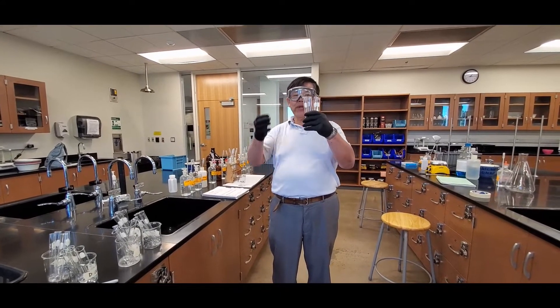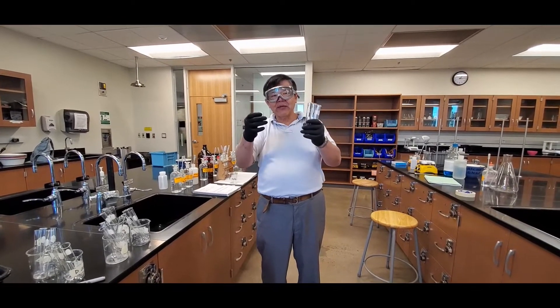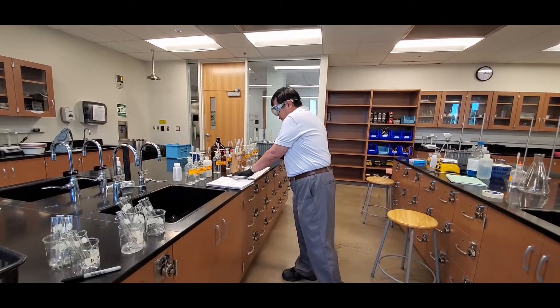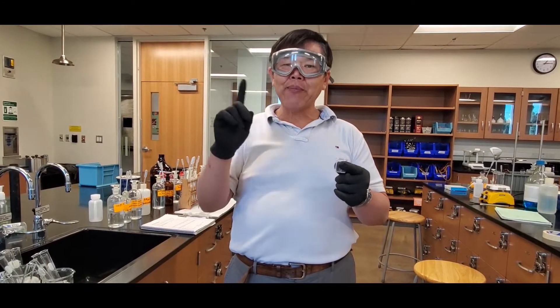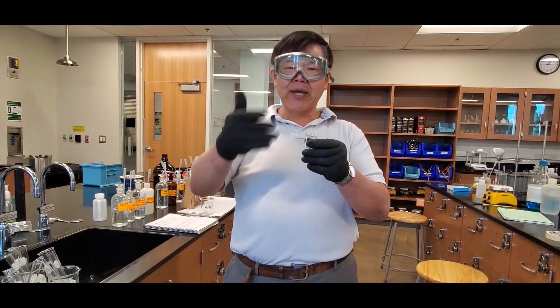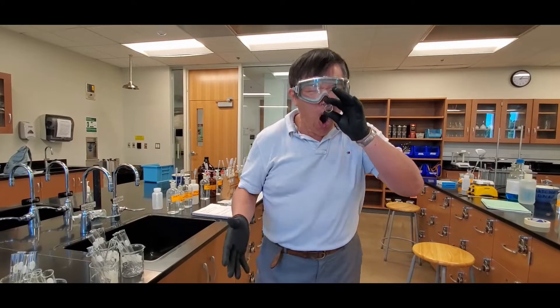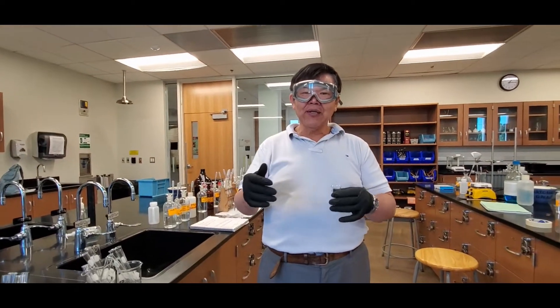For each test you will need four test tubes and a beaker. The beaker is what we call the sniffer — this is only used for the ammonium nitrate column. When sniffing, take a deep breath first, then waft the fumes toward you. If it's irritating, you can snort the air back out. Never directly inhale — you'll burn your nose. That's the proper sniffing technique.